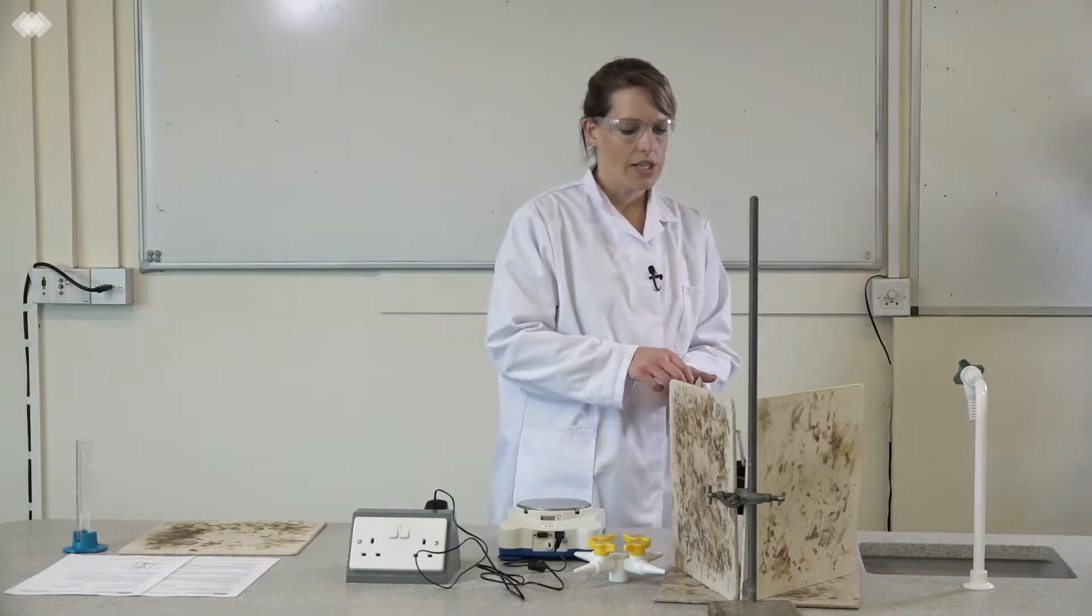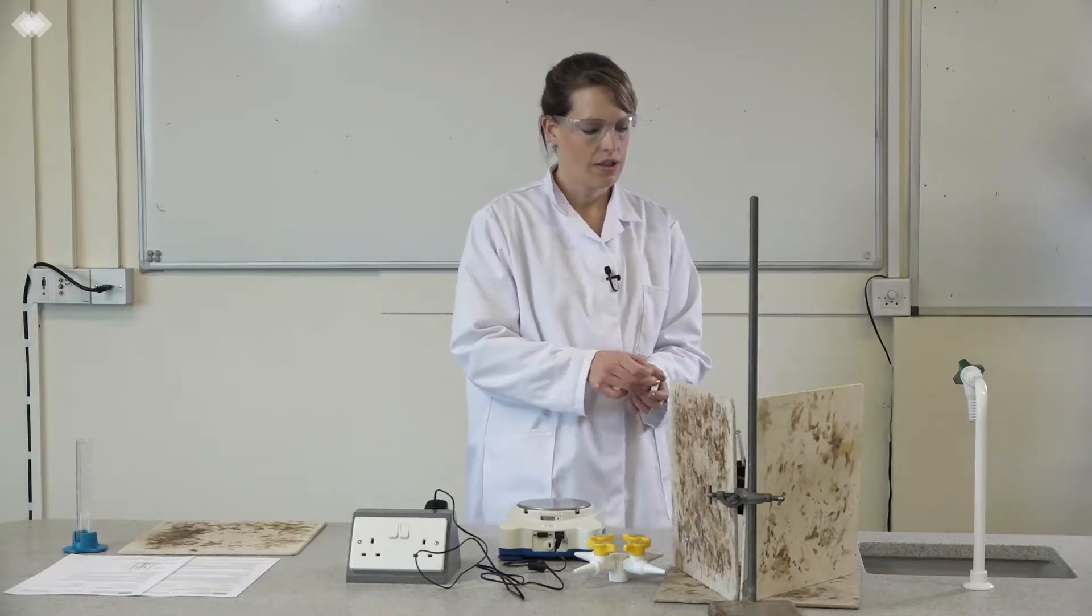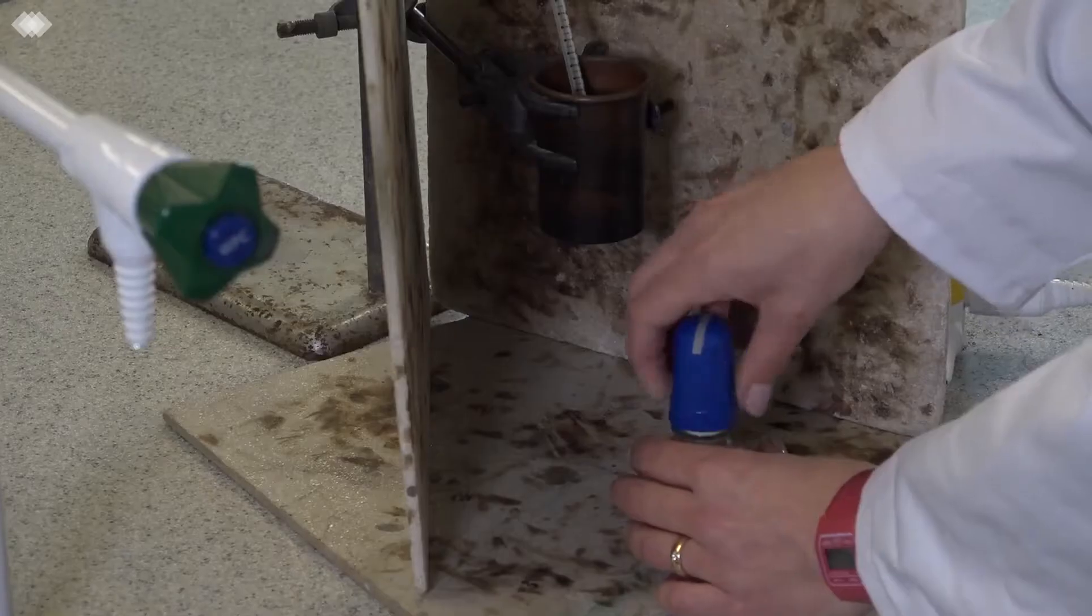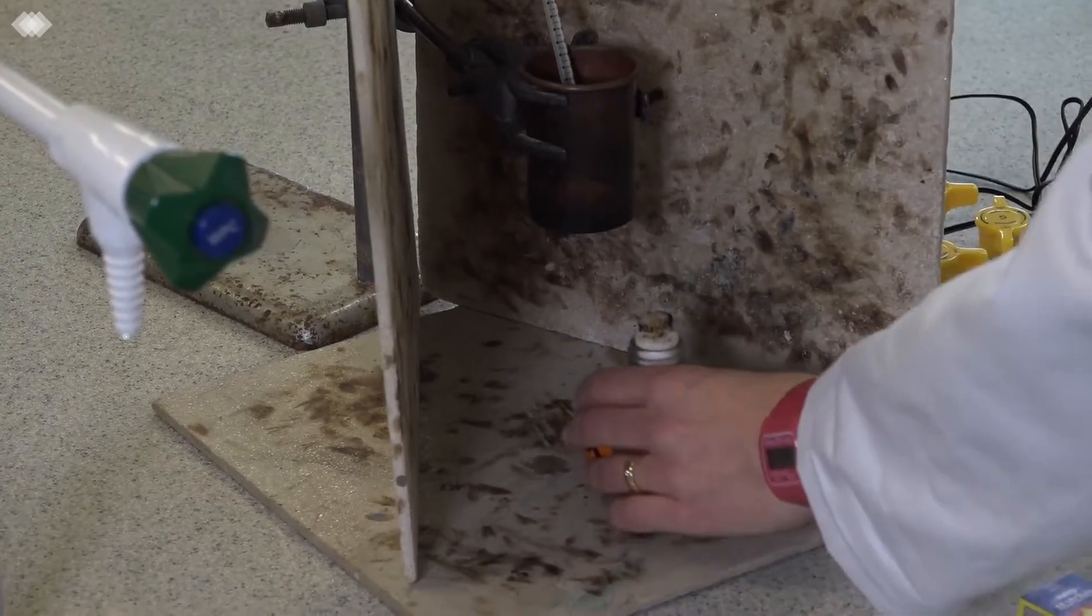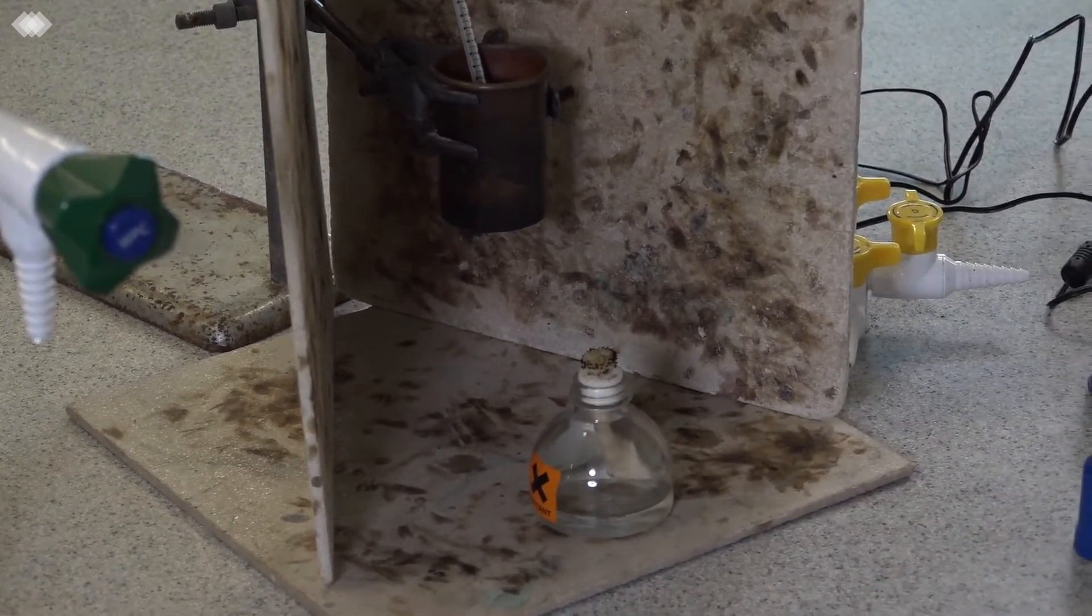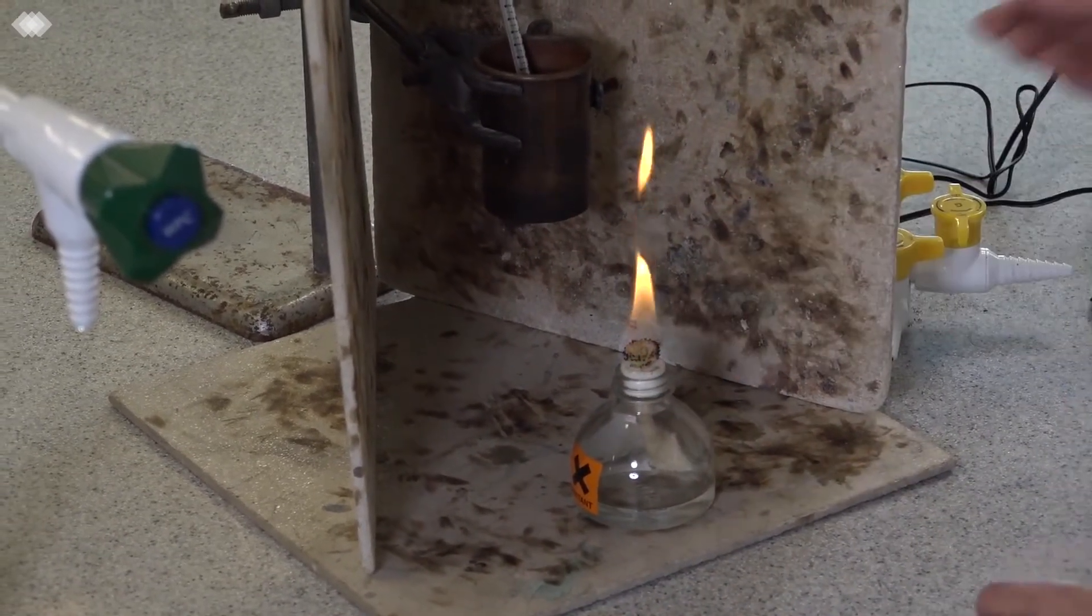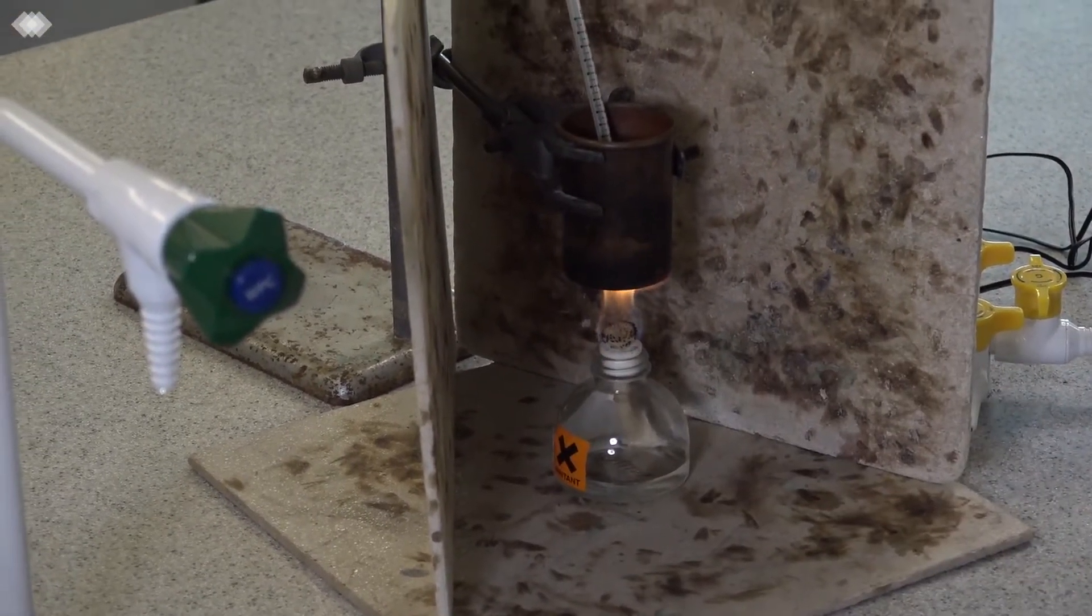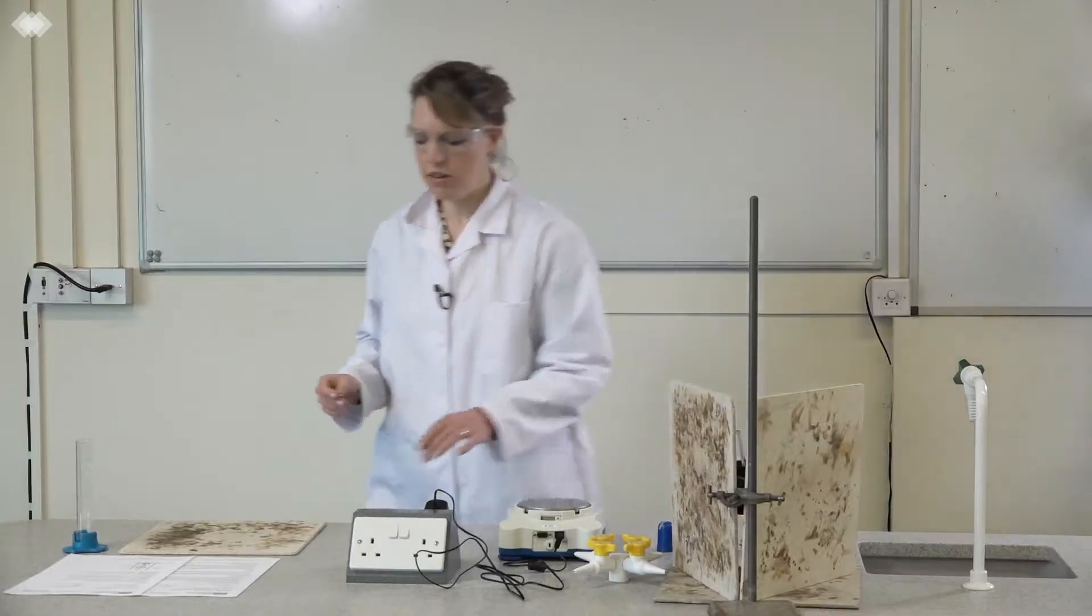When you're ready to light it, remove the lid and immediately light the burner. Importantly, the alcohol can evaporate, so you must make sure that you light it as soon as you take the lid off.